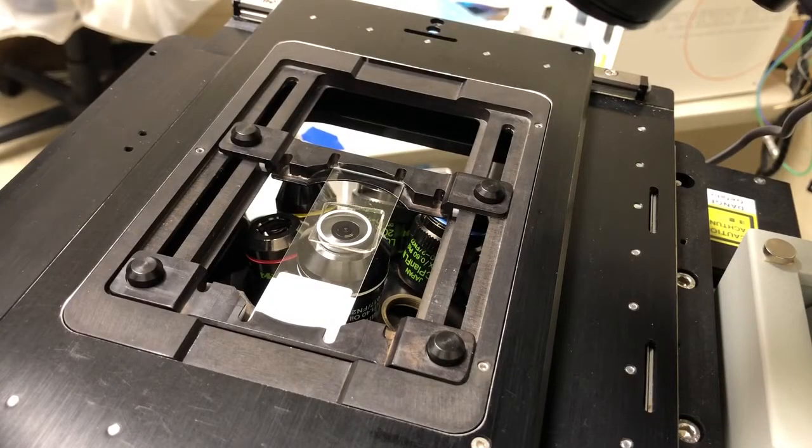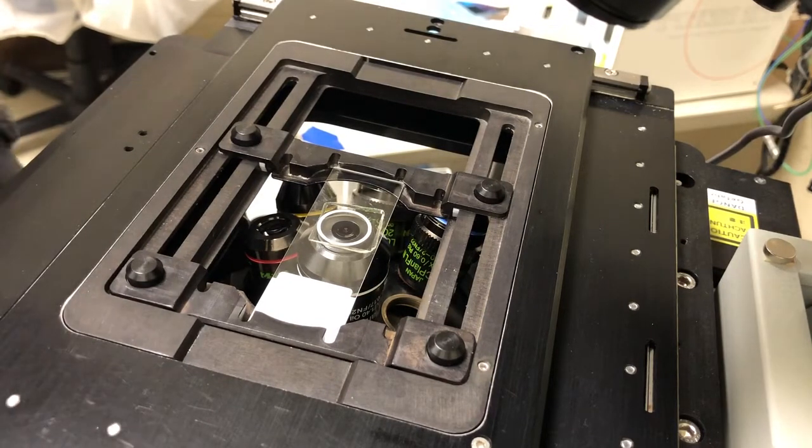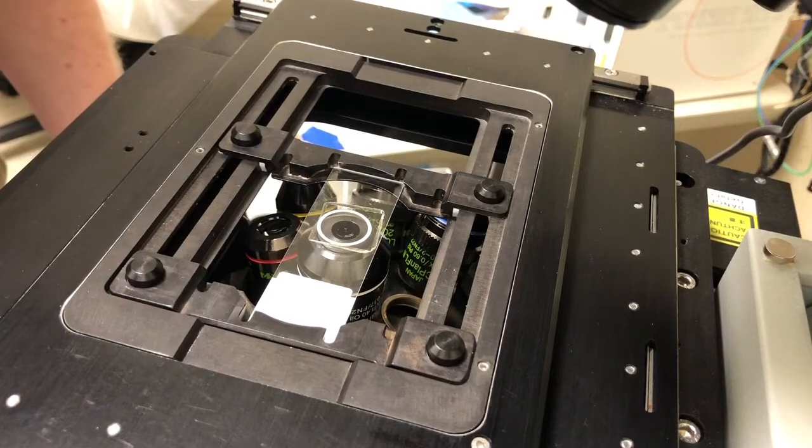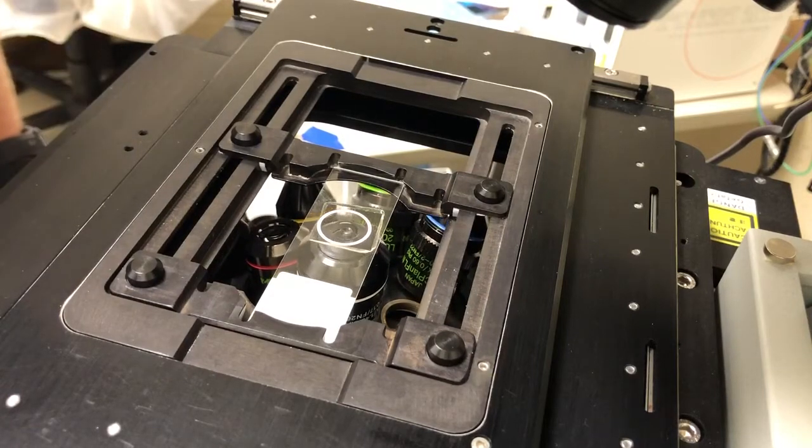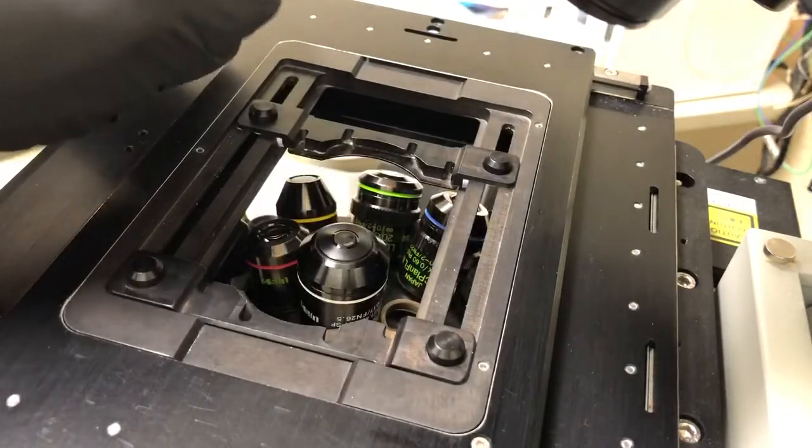Now that the imaging is complete, let me show you how to safely remove the sample, clean the objective, remove it, and store it. As always, the first thing we need to do is press the Escape key to move the objective away from the sample, and carefully remove the sample.